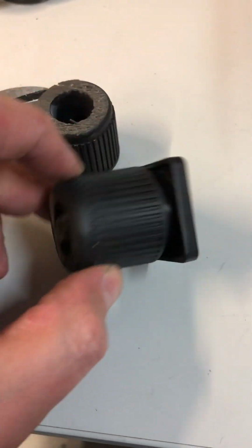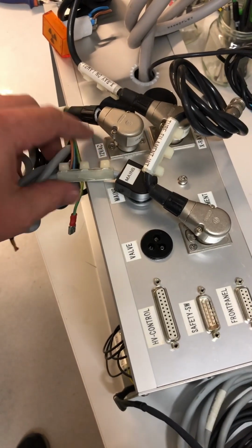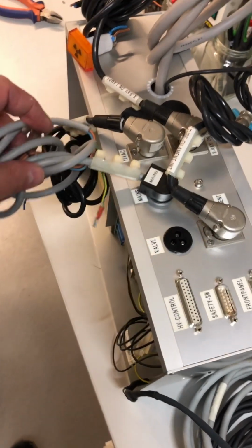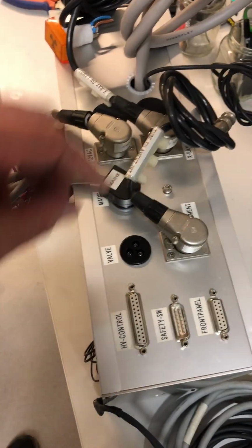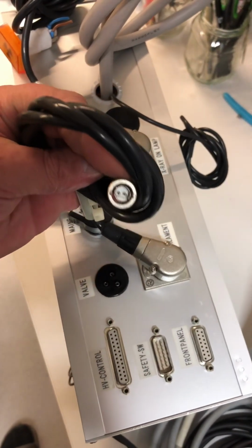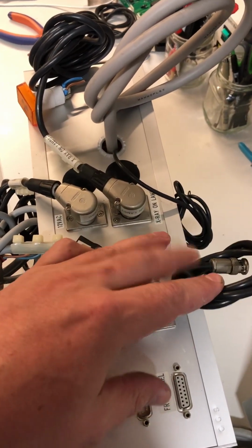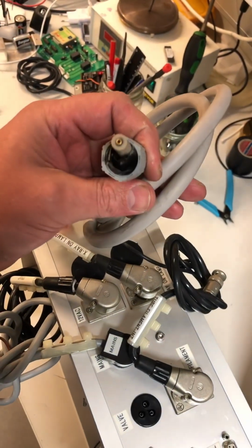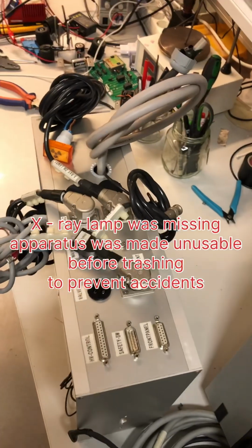Legs with adjustable height. Main module has a 12 volt AC connection for the filament of the X-ray lamp. Then it has 230 volt mains, and here goes the valve to the vacuum valve. Then we have the filament, which has such a connector, and the X-ray indicator lamp. And this is a high voltage cable, very soft, and the lamp is removed for safety.